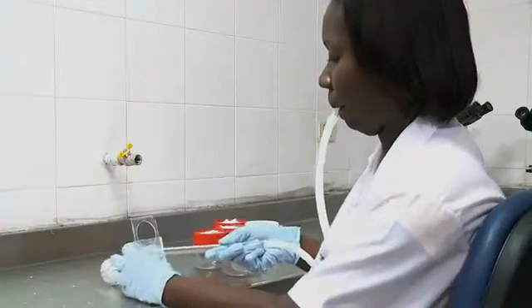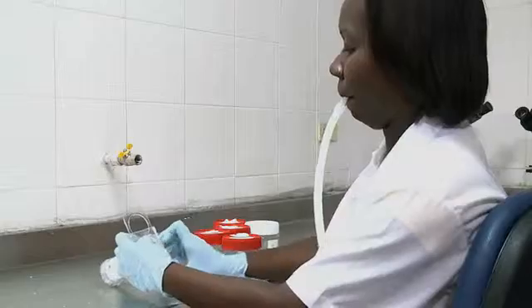This video shows methodology for testing insecticide susceptibility using insecticide-impregnated papers on malaria vectors.